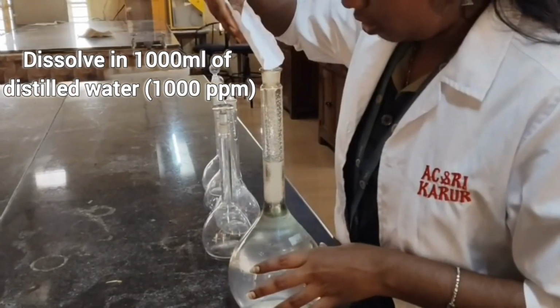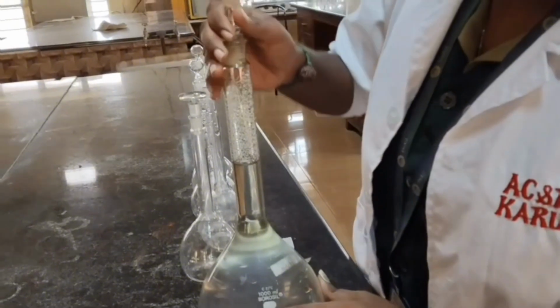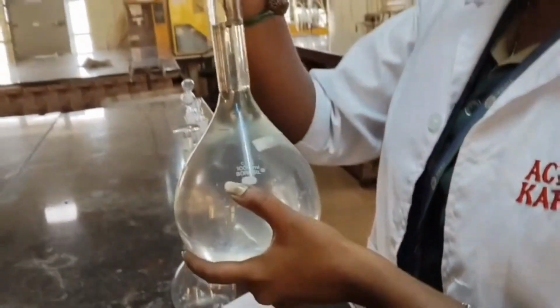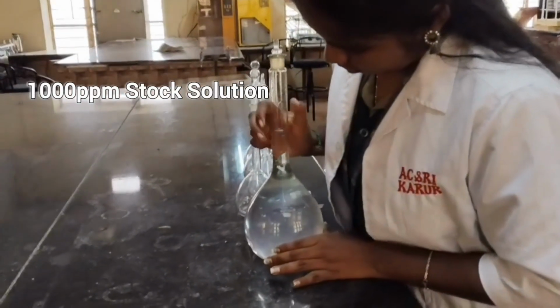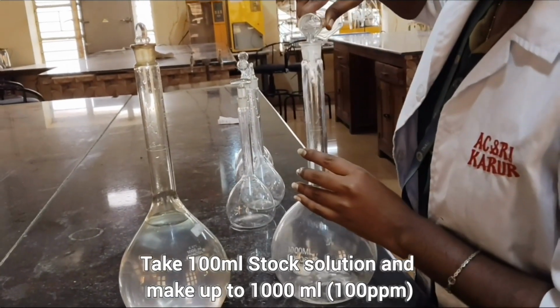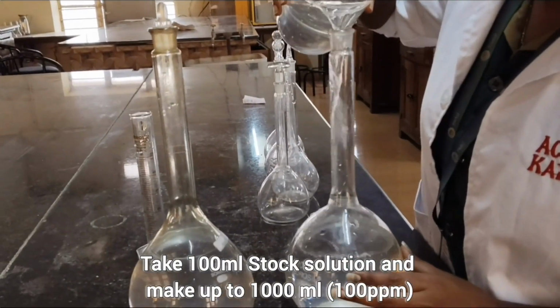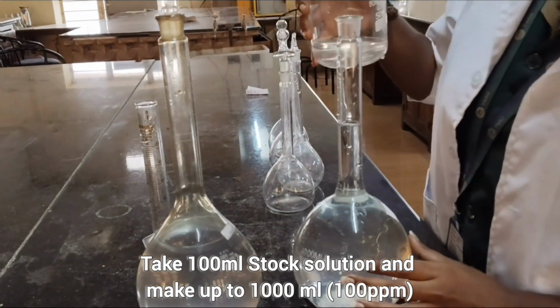Now dissolve the 2.54 gram of sodium chloride in a volumetric flask containing 1000 ml of distilled water. Shake well so that the reagent gets dissolved. Thus, the stock solution of 1000 ppm sodium is ready. Take 100 ml of the 1000 ppm sodium solution in a 1000 ml volumetric flask and make up the volume to 1 liter using distilled water. This gives 100 ppm of sodium stock solution.